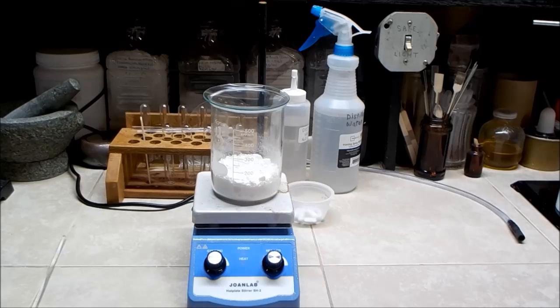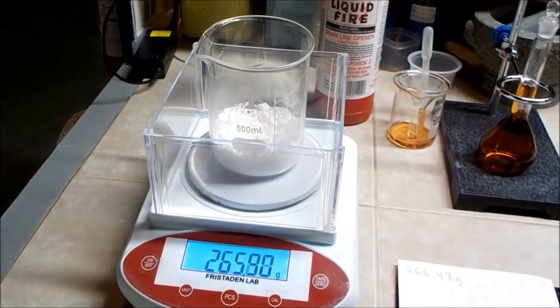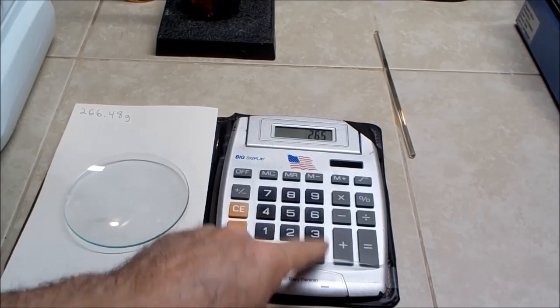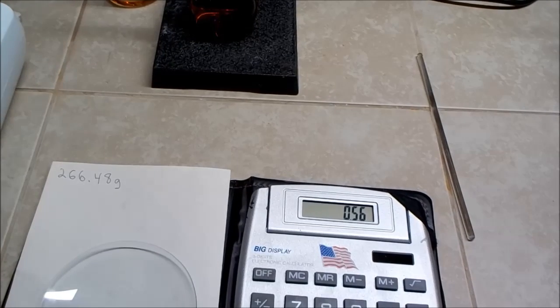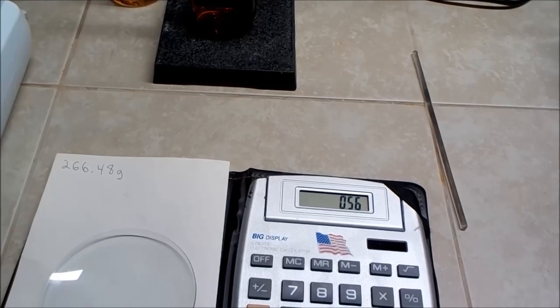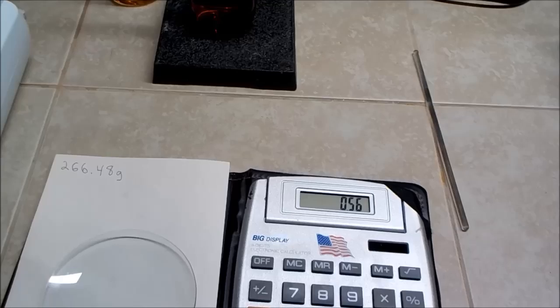I'll let it sit for about 5 minutes because I don't want to put the hot beaker directly onto my scale. So I'll let it cool down some and then I'll give it another weigh. We lost about 0.56 grams from heating, so it was almost dry, but it was worth doing. But I still don't know the exact weight of the calcium nitrate because I don't know the weight of the beaker. So I'll have to solve that, but that shouldn't be very hard.